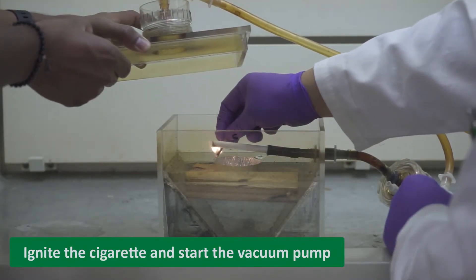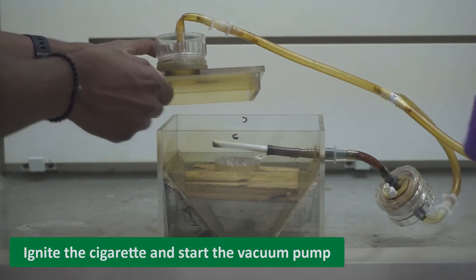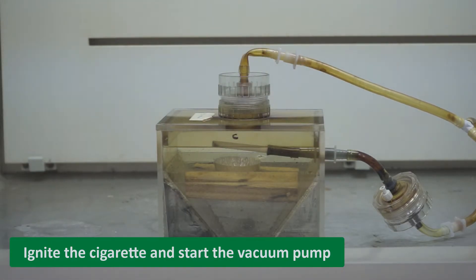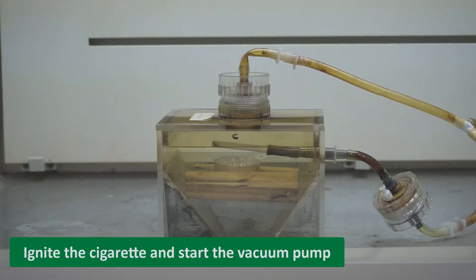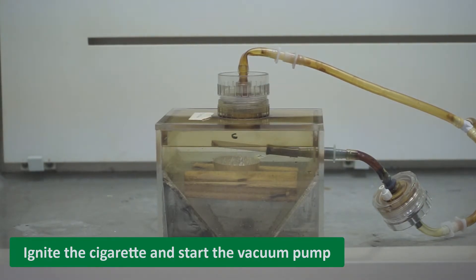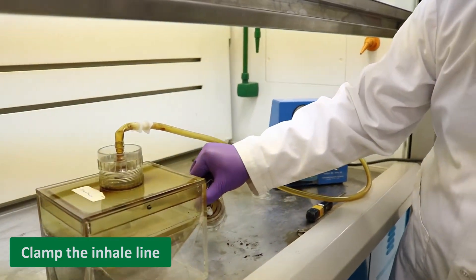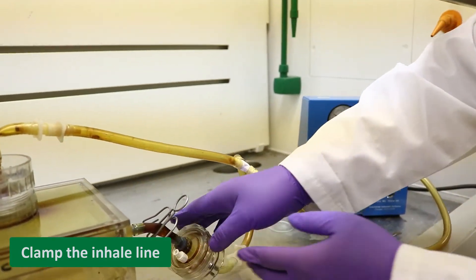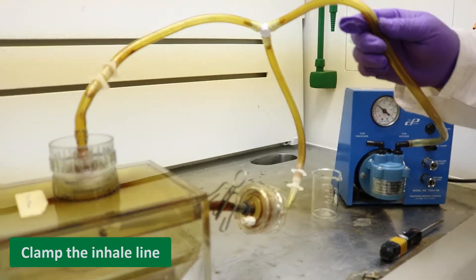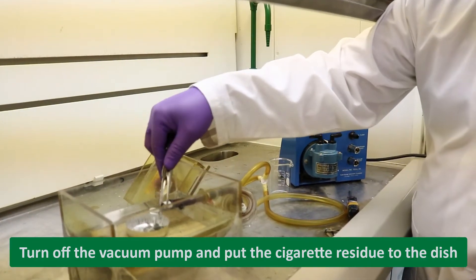Use a match to ignite the cigarette, cover the smoking chamber, and start the vacuum pump. This should be done by two people in tandem. When the cigarette is almost finished, clamp the inhale line to let the residual smoke go to the side stream line. When the smoke is gone, turn off the vacuum pump and open the chamber.